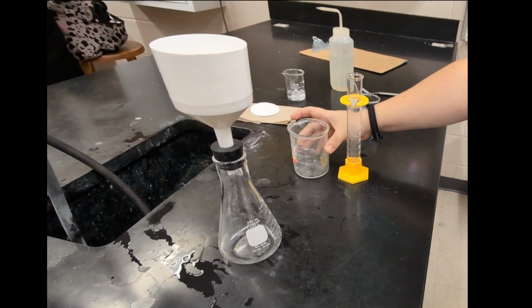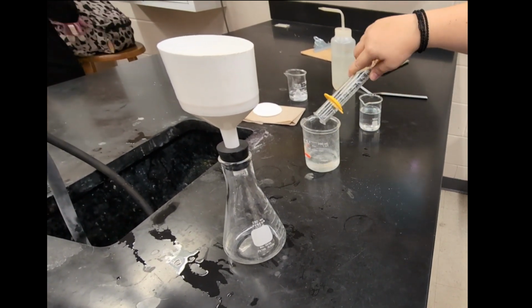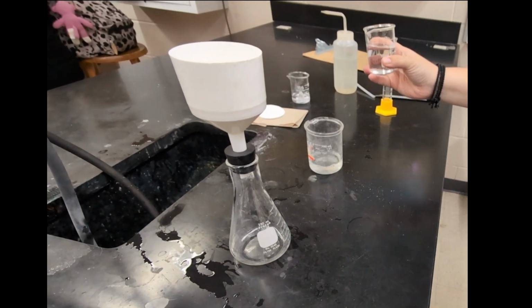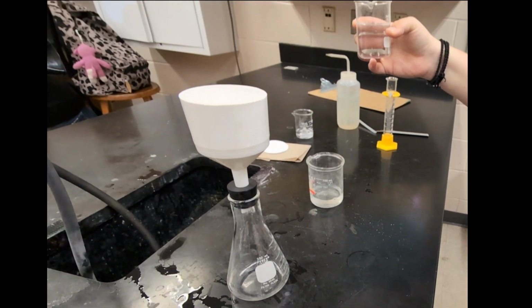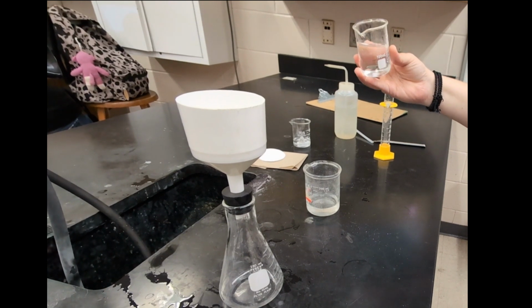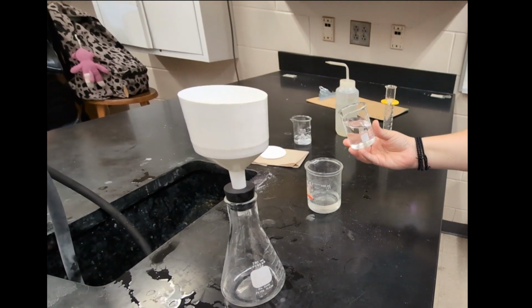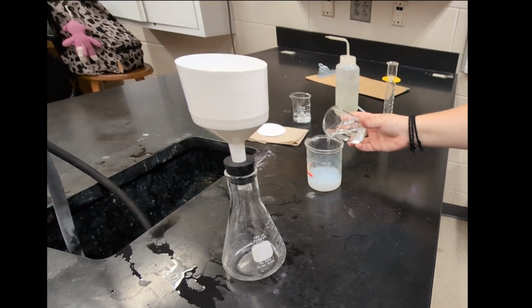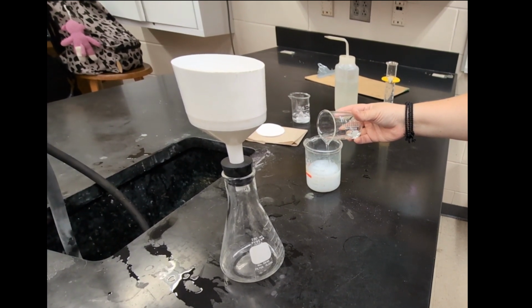So I'm going to add that calcium chloride into the beaker. This is going to be our limiting reactant. And then I'm going to add in excess of our sodium carbonate solution. It is saturated. There is a tiny bit of solid sodium carbonate at the bottom. I'm going to try to decant so that that solid doesn't get transferred over to the beaker. But as long as you have an excess of the solution, it should be fine. And so you can immediately see the calcium carbonate precipitate forming.